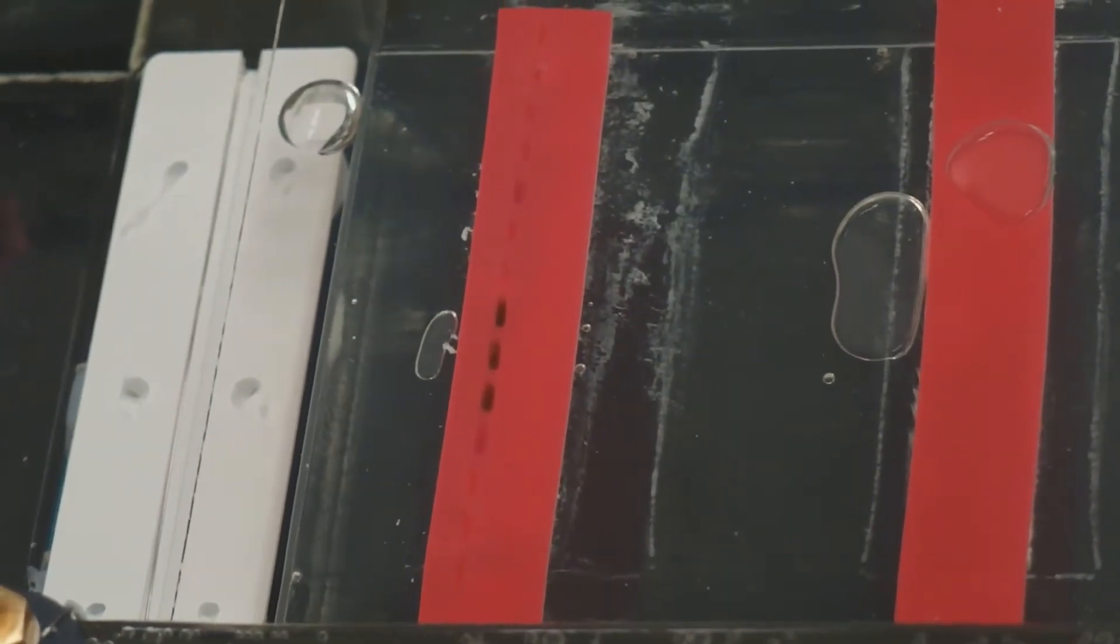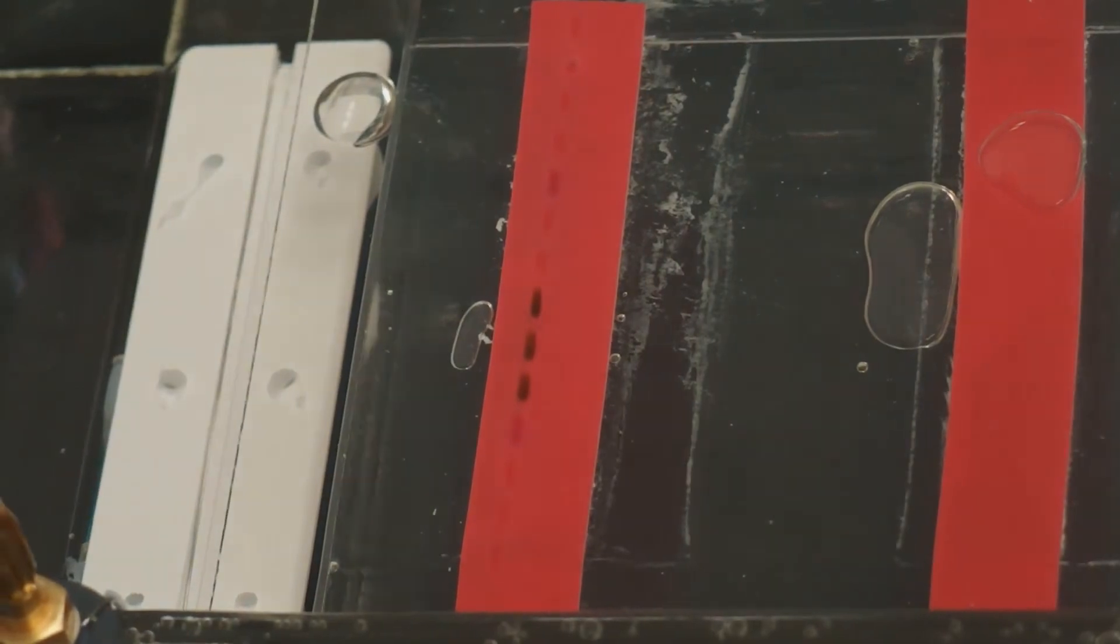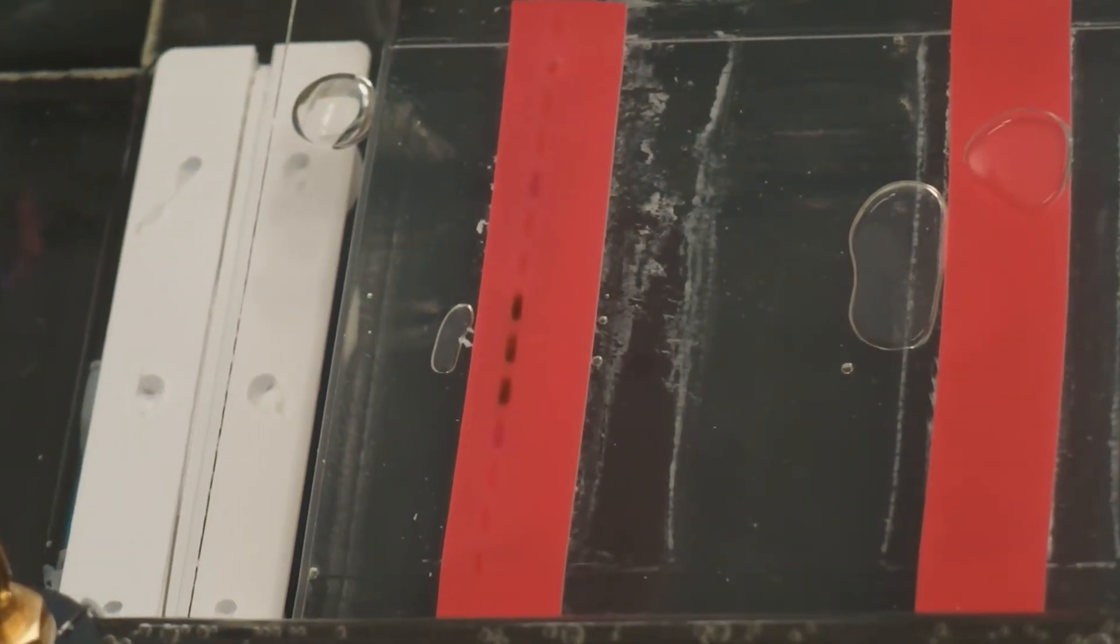Not all gel boxes have a red line to load on. You can put that on there yourself. This is just a piece of electrical tape, red electrical tape.